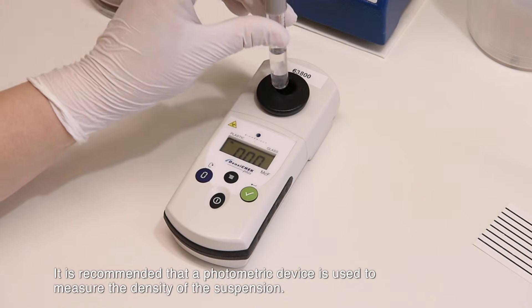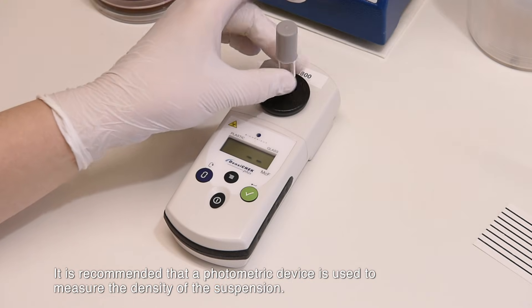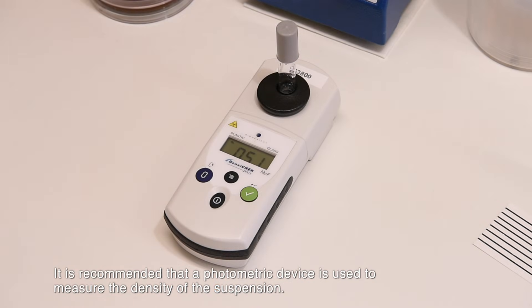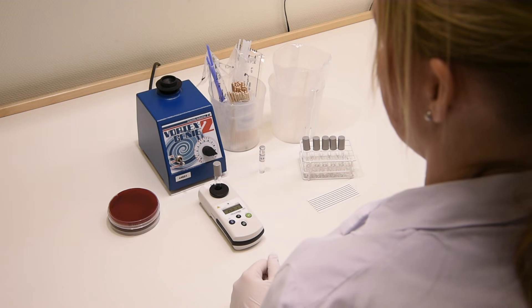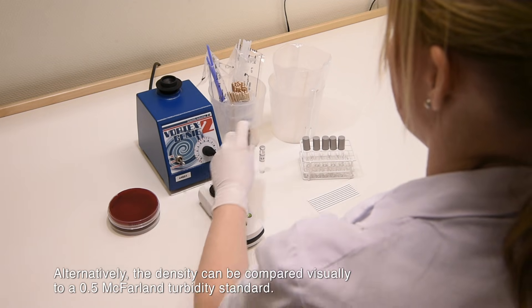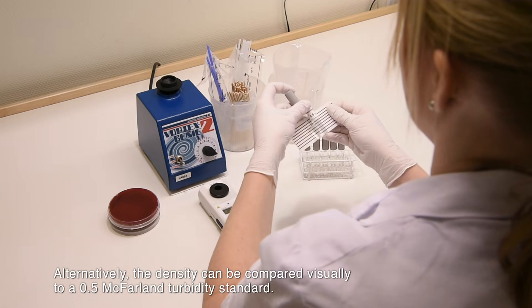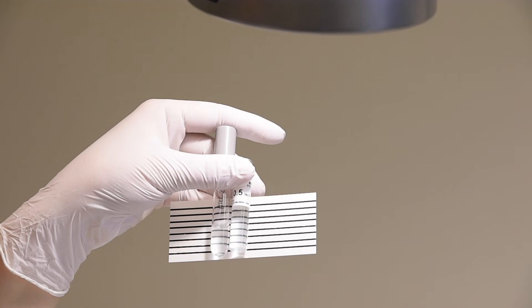It is recommended that a photometric device is used to measure the density of the suspension. Alternatively, the density can be compared visually to a 0.5 McFarland turbidity standard.